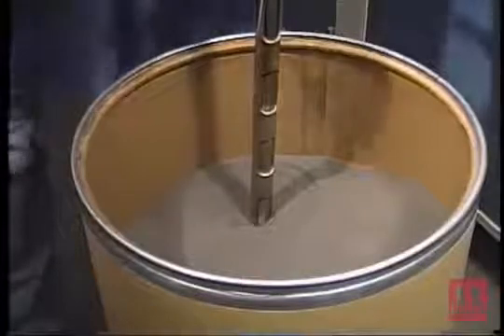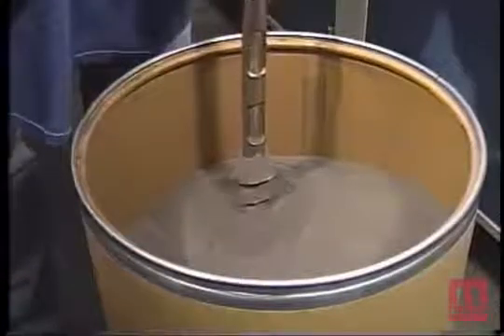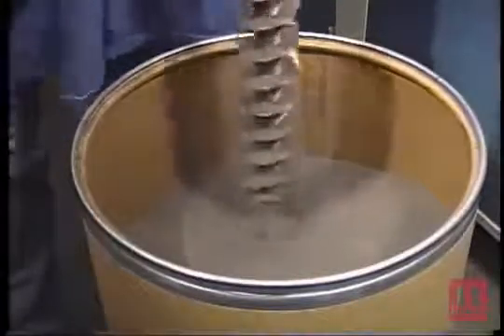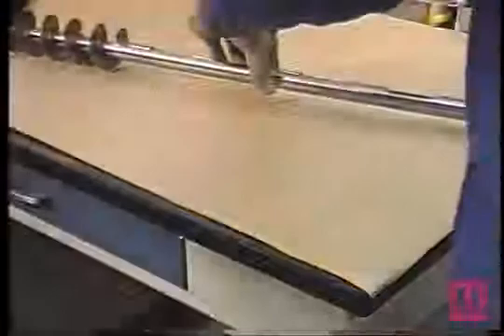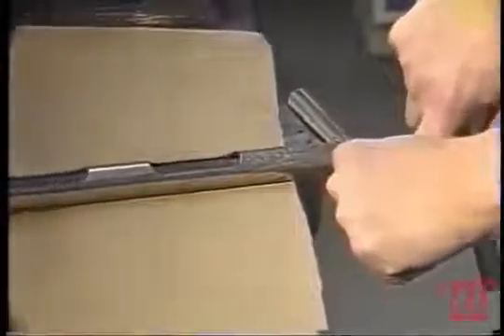The sampler is then removed from the container, positioned over a large piece of paper to collect its contents, and the handle is twisted to the open position so the contents are emptied.